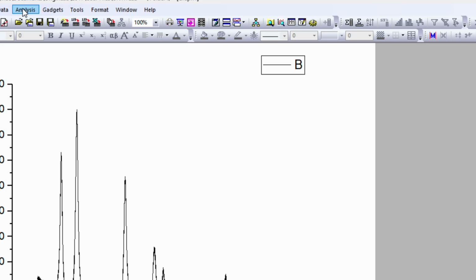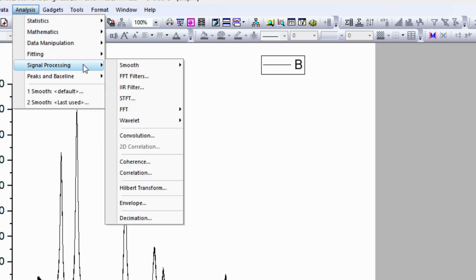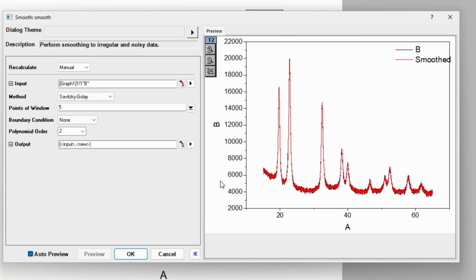Go to analysis and over here go to the signal processing. In the signal processing, go to the smooth option. In the smooth option, choose open dialog. So first click on the auto preview option. Here we can see the red one is the smooth and the black line is the original experimental data.